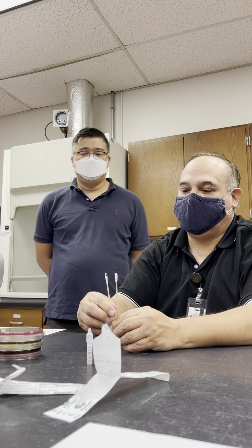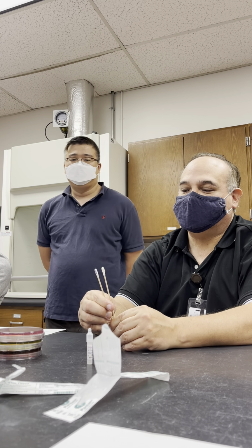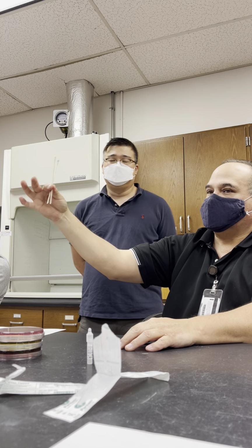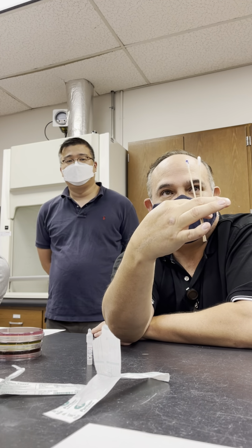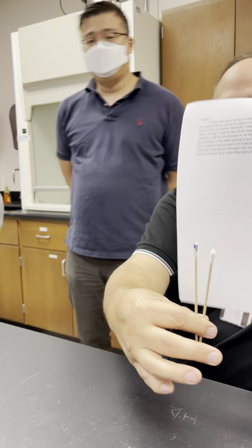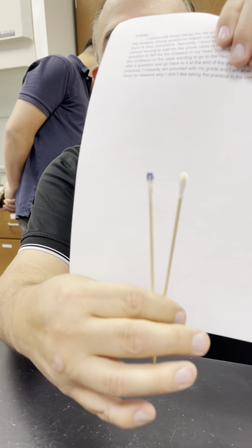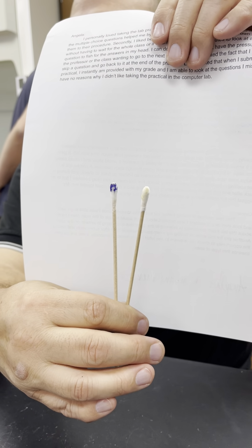So can you appreciate that positive, negative? If you guys will take a picture of this, this can be for your data, but let me get it perfect. And then you can just put this. You can do the test if you want, but this can be your data. Thank you, Miss Carolina. You were awesome.